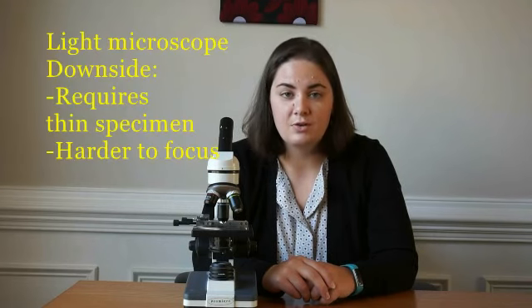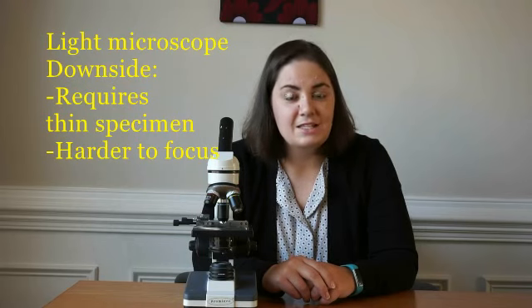But I recommend that you don't shy away from making your own slides, as it's not as difficult as it seems. The other difficulty that many students have with compound light microscopes is focusing on the slides, as it's significantly more difficult than with a stereo microscope. Thankfully, in the second portion of this video, we'll be looking at 5 easy steps for focusing on a slide.